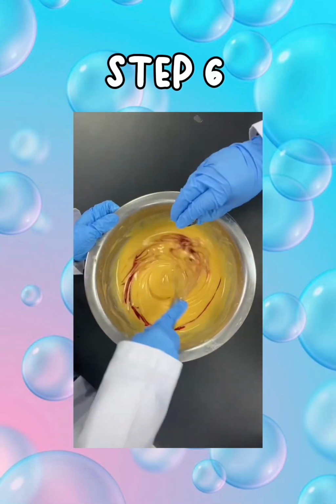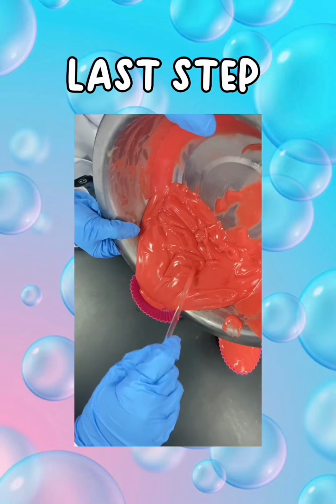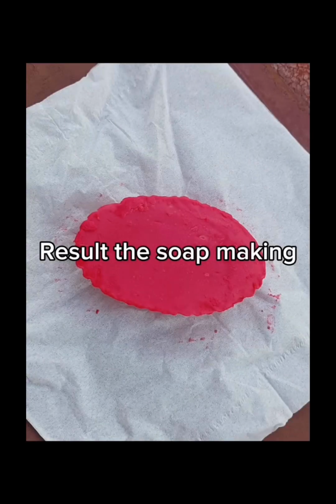Lastly, we added food coloring with 80 ml of water and continued stirring the mixture. Pour the soap solution into a silicone mold and rest it for 24 to 48 hours.